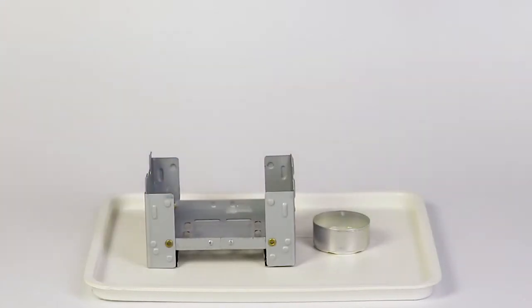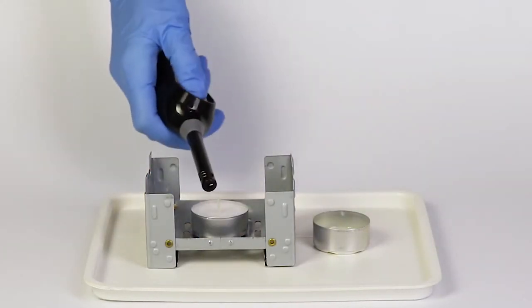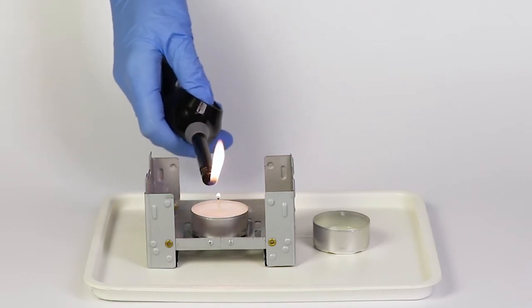Prepare the solid fuel stove. Put one candle into it. Light the candle and cover the stove with the flame diffuser.